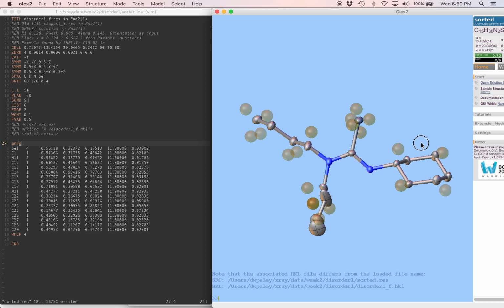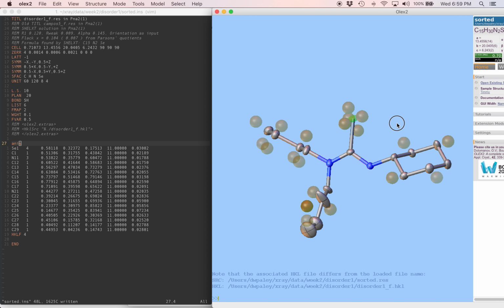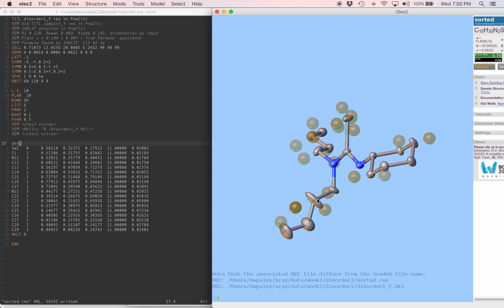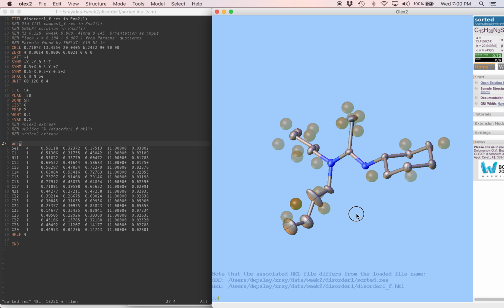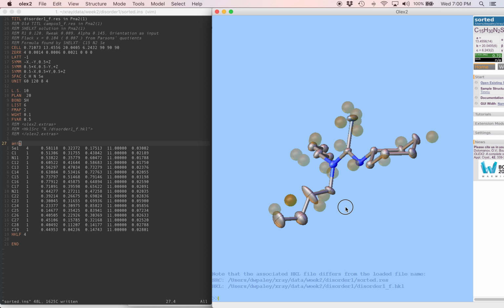Let's take a look at the anisotropic model. Okay, well, first of all, around the selenium, this obviously looks a lot better, but around this alkyl chain, now we have some problems. There's a big difference feature that's 2.4 electrons, much bigger than you would expect to see near carbon atoms if everything was normal. Besides that, this carbon, maybe I would call it kind of surfboard shaped, but in any case, definitely pretty unusual for an alkyl chain.